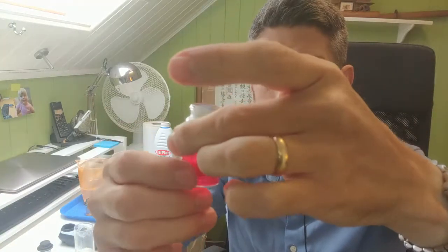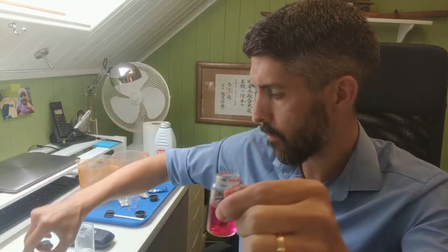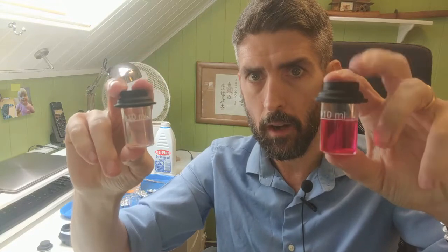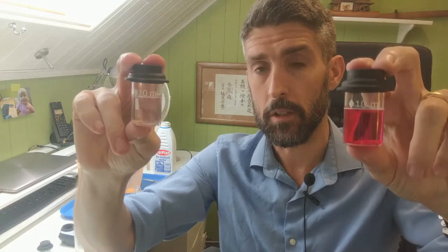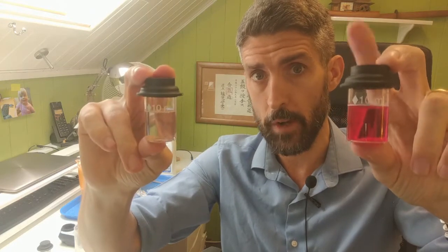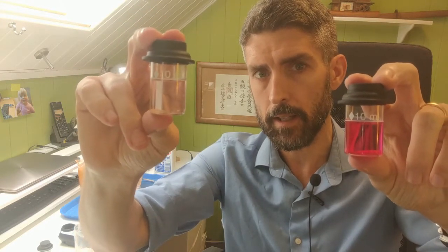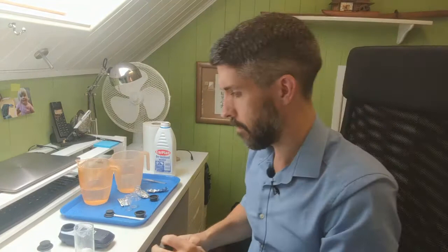What you can see is that it's a pink colour. Now I'll compare it to this one, which is the undiluted one. This one's the diluted one. It looks like that one's got much more chlorine in, but we know that actually that one has got 10 times more chlorine in than this one. It only looks like there's not very much chlorine in there because of the bleaching effect that's taken place. So let's take a reading with this one and see what we get.